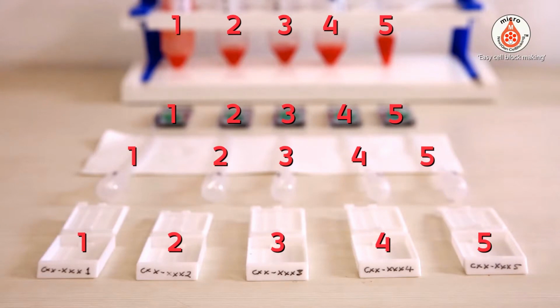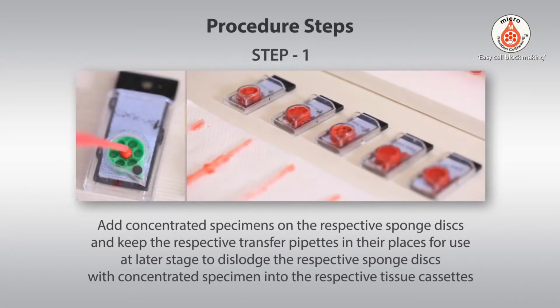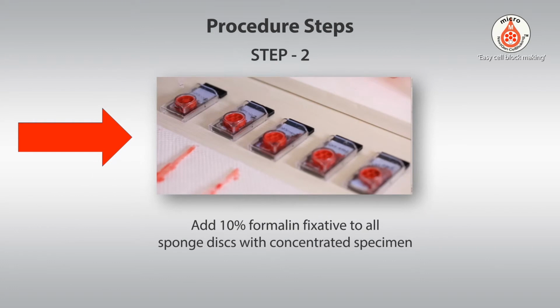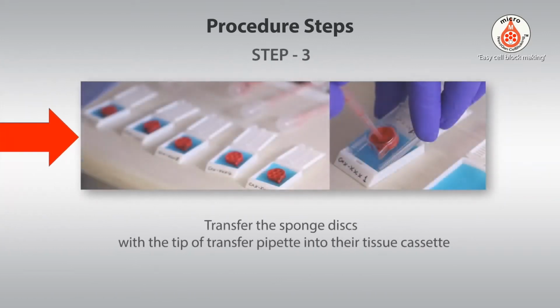Procedure steps. Step 1. Add concentrated specimens on the respective sponge discs, and keep the respective transfer pipettes in their places for use at a later stage. Step 2. Add 10% formalin fixative to all sponge discs with concentrated specimen. Step 3. Transfer the sponge discs with the tip of the transfer pipette into their tissue cassette.